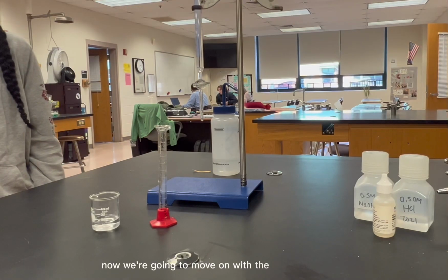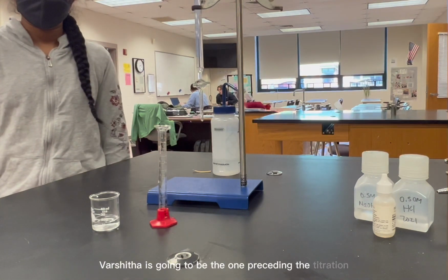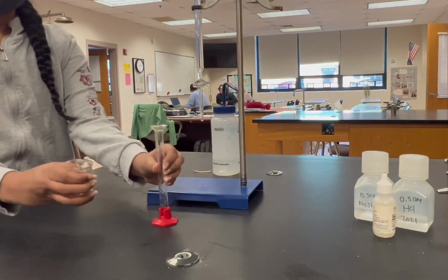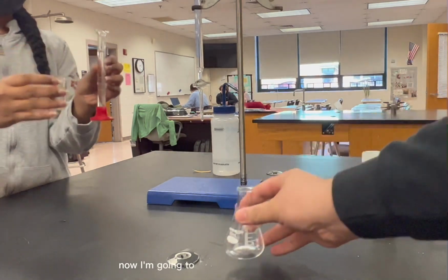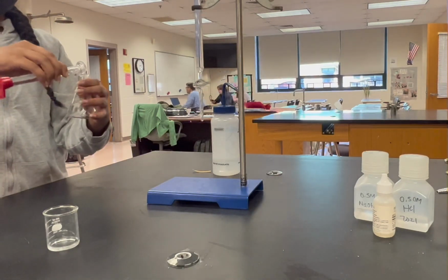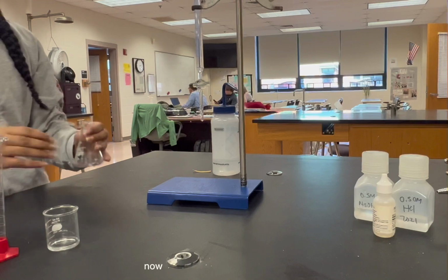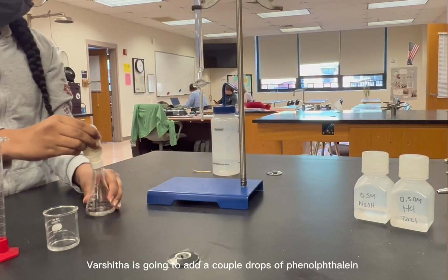Now we're going to move on with the titration of Polar. Varshitha is going to be the one proceeding with the titration. She will be measuring out exactly 10 milliliters of Polar as done before. Now I'm going to hand her an Erlenmeyer flask that she's going to put the drink in. Now that the solution is in the flask, Varshitha is going to add a couple of drops of phenolphthalein.